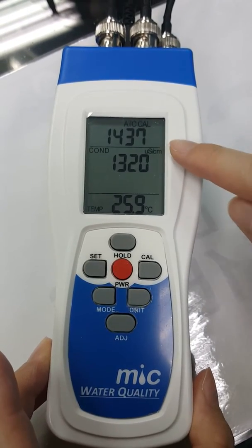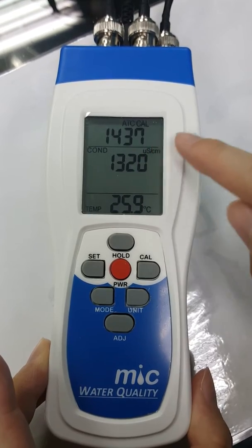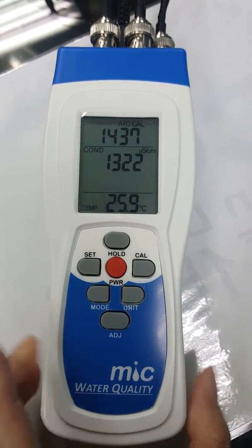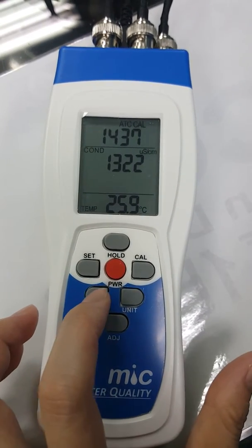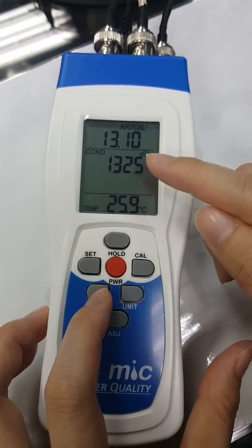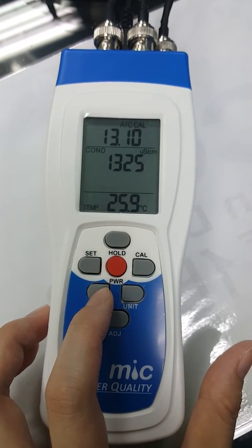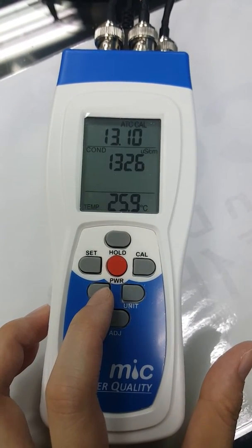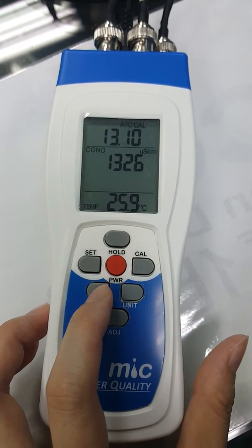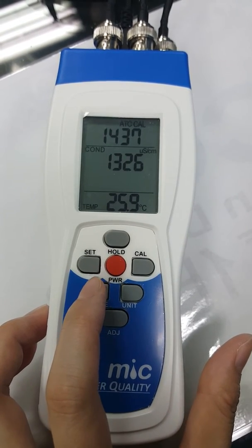Now we are in the 1413 calibration mode. Short press the mode button to go to the 12.88 calibration mode. Short press the mode button again.